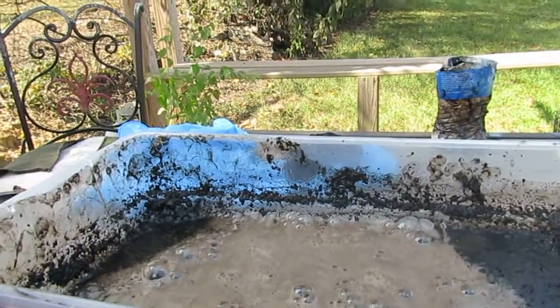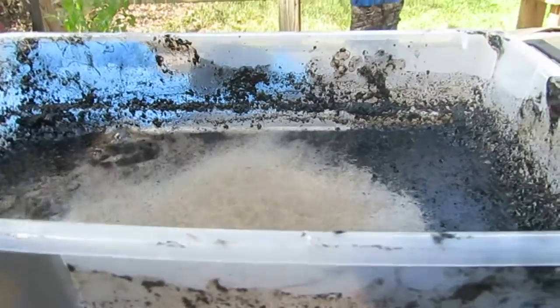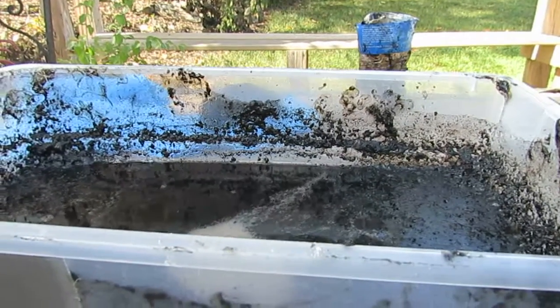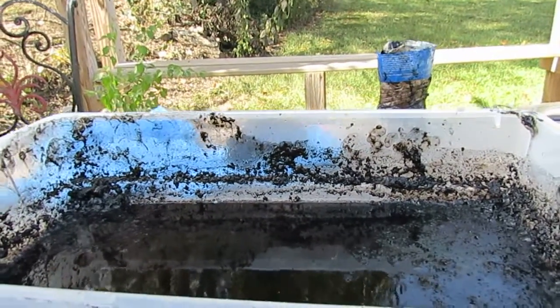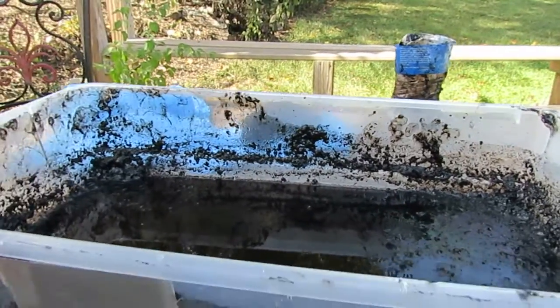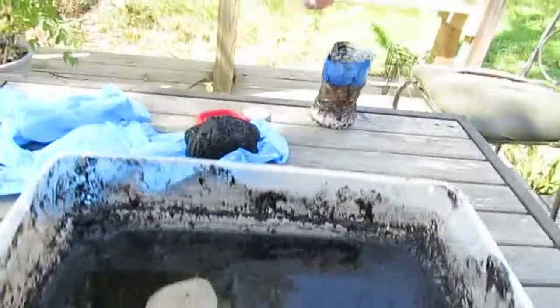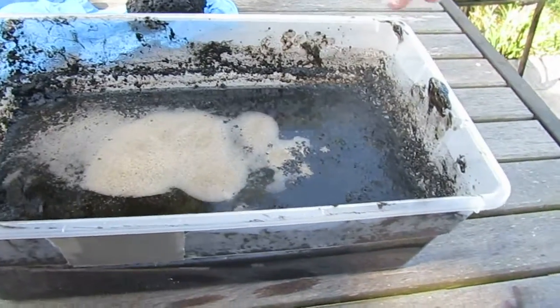It's going to take forever. You can kind of see the vapor off of here. This video is going to be shorter than the other one, because this is really all it is. I'm probably just going to wash it out with distilled water — I had a brain fart. Oh look at where it's spraying. Well, this is going to take a while.